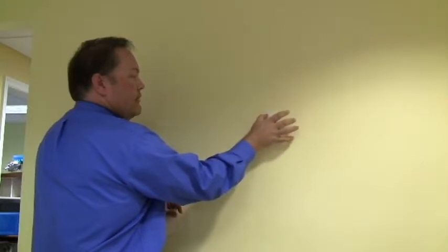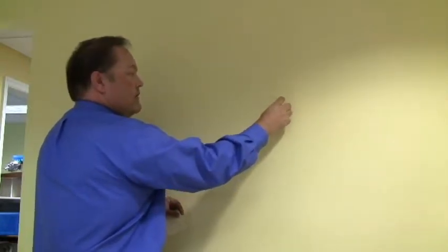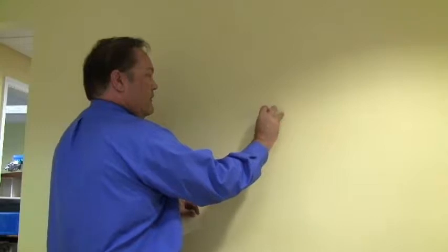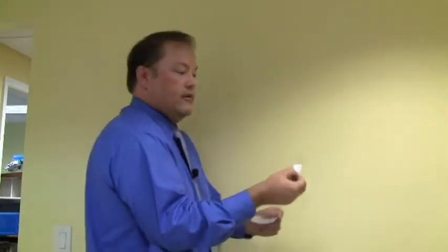Simply like that. I just rub a light finger swipe across it and pull it back off without touching that surface.